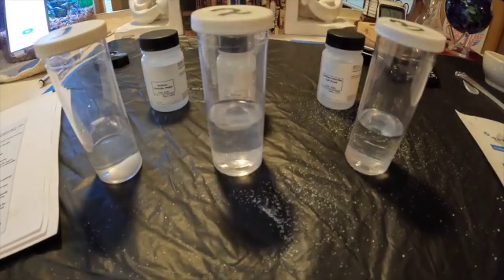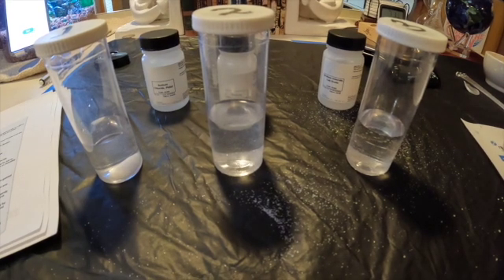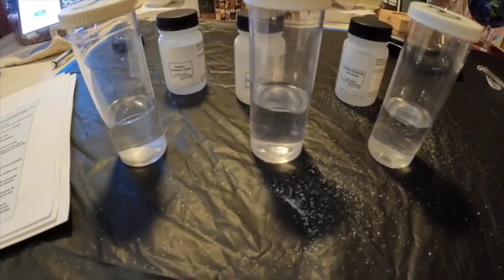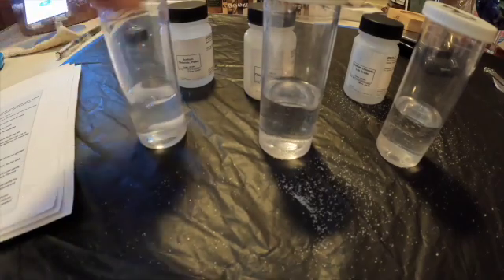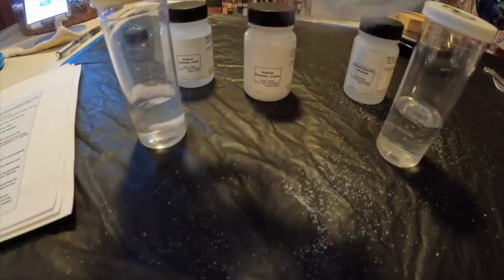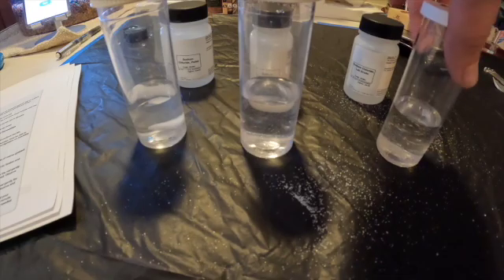Now I'm going to agitate the vials for another few minutes. Vial number one with the pellet — this is your observation. Vial two with the coarse grain salt — you can still see particles floating around there; it is dissolving some. And vial three is getting pretty clear — a little bit better, but still not fully dissolved.